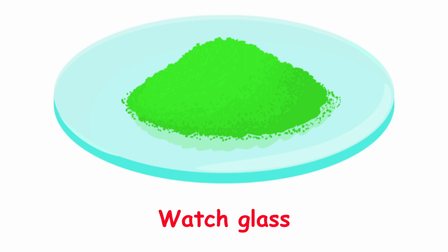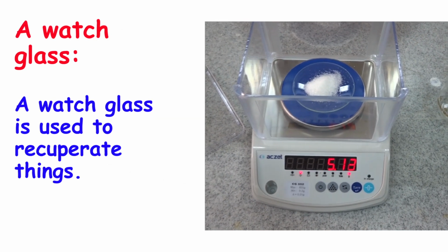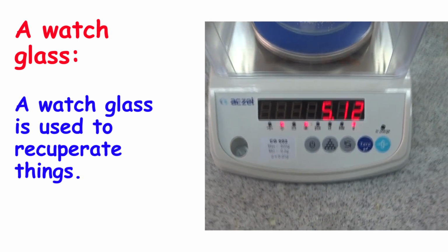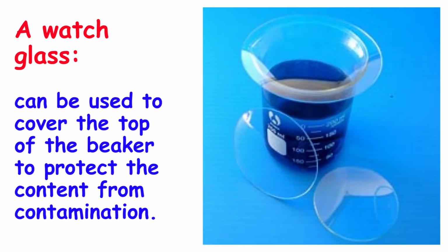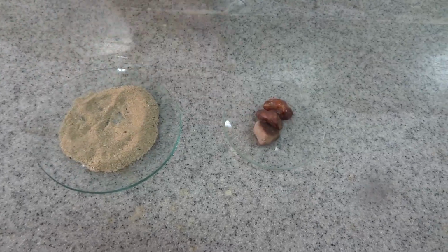A watch glass. A watch glass is used to recuperate things. It can be used to hold the chemical on the balance to weigh its mass, and it can be used to cover the top of the beaker. In this example, the watch glass is used to recuperate the small rocks.